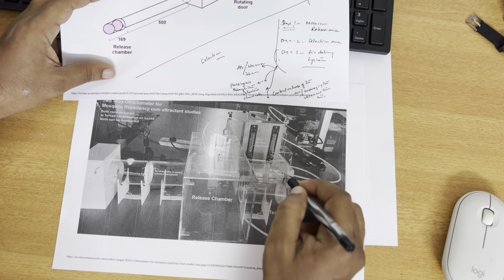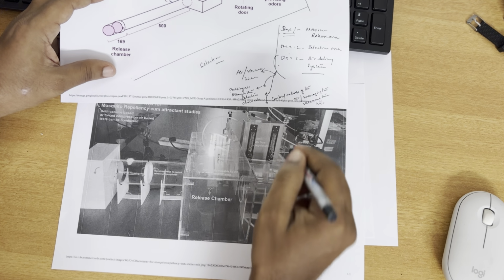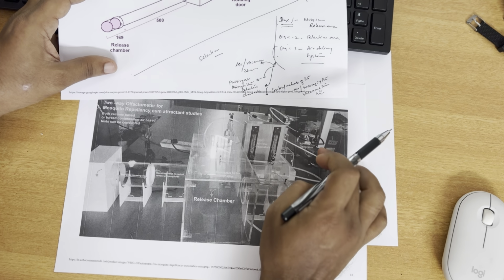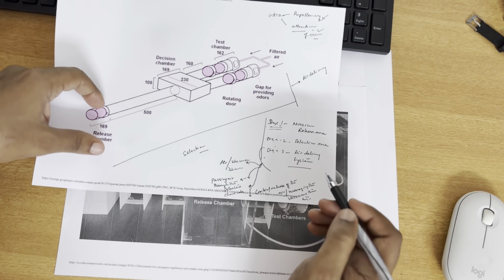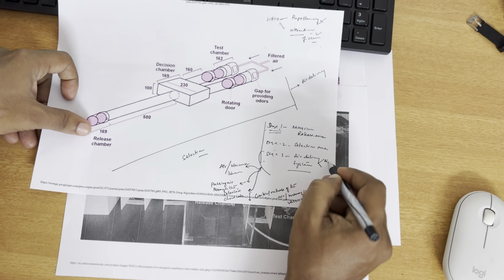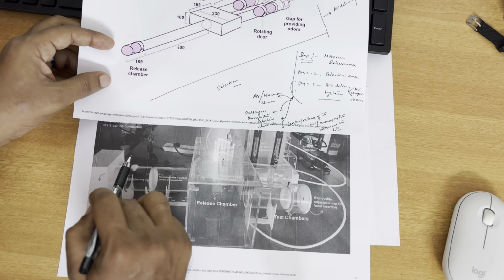In order for the selection to be done, we need to send the scented air either to this as well as to this. So the air delivery system is this. You see here the air control valves as well as the air control generator. As I said, you can do both. The air delivery system can be both vacuum based as well as air compression based. The vacuum based will be here in this area.